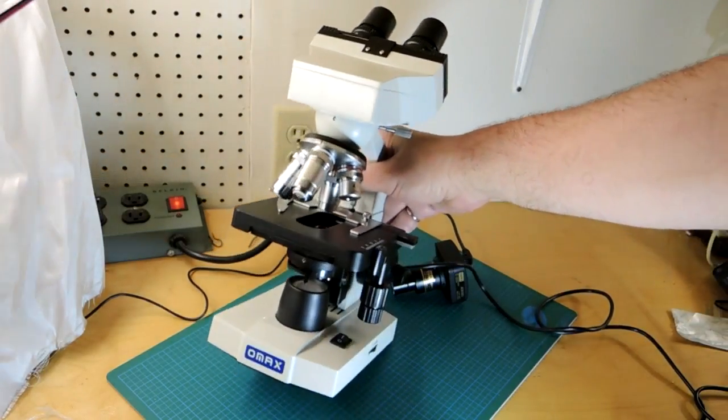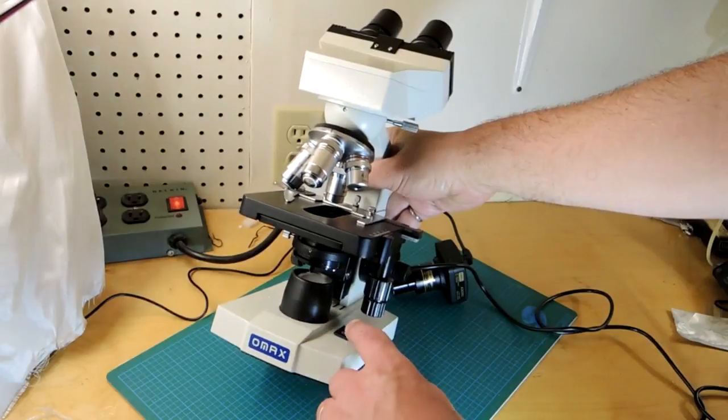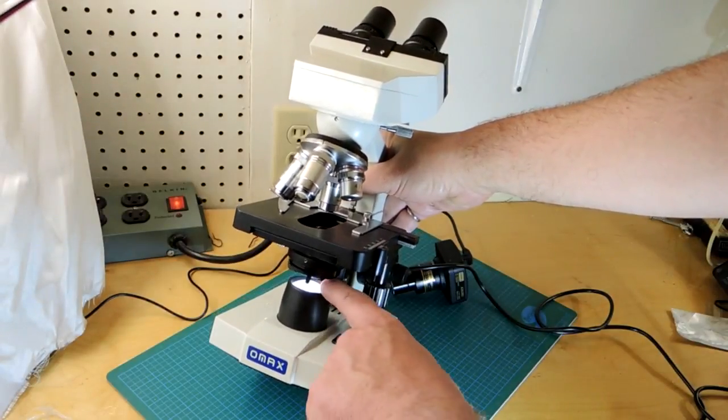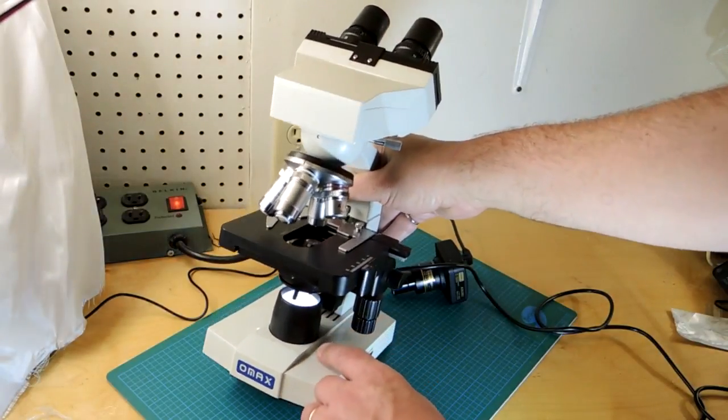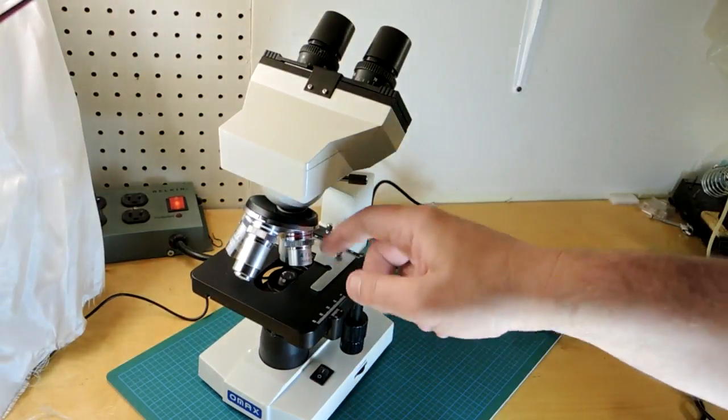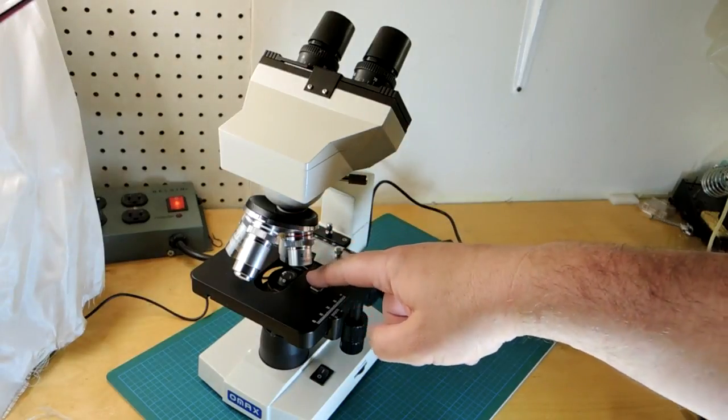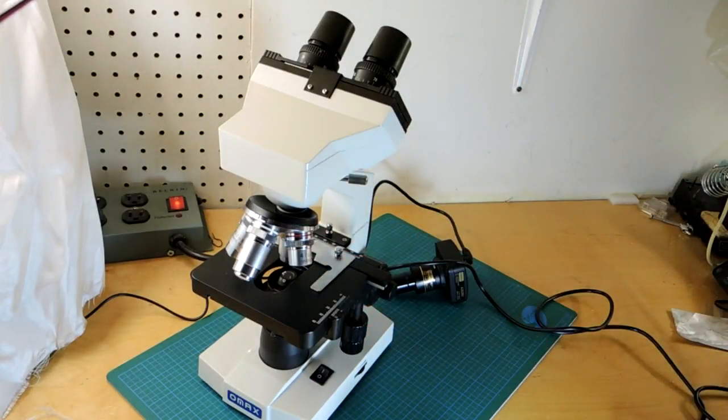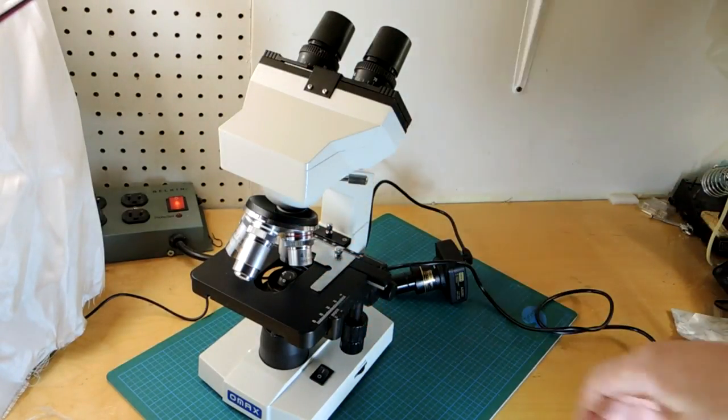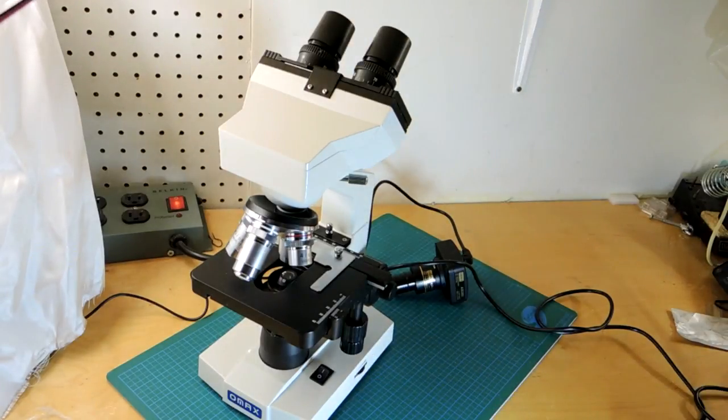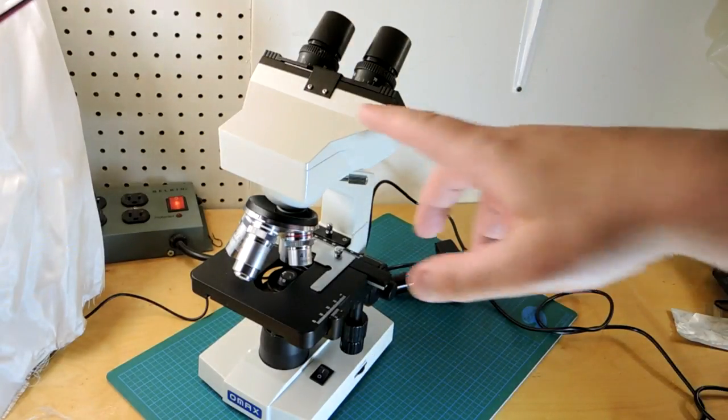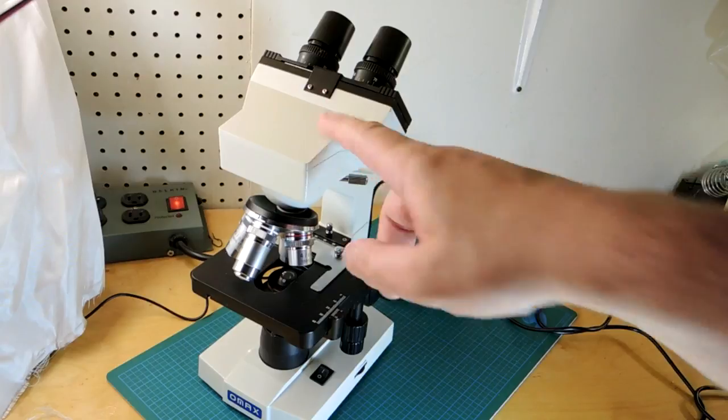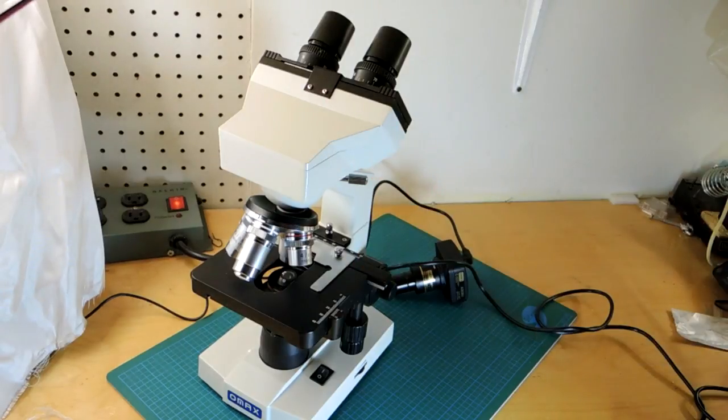The problem with this one for me though is it's mostly a biological microscope. It has a light down here you can turn on. That shines light up through the sample. Really classic when you're doing biology but not quite as helpful for the microscopy I'm doing for my teardown videos which tend to be engineering related.